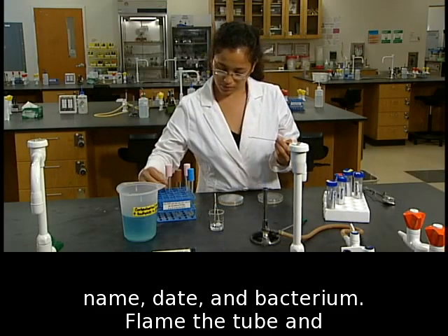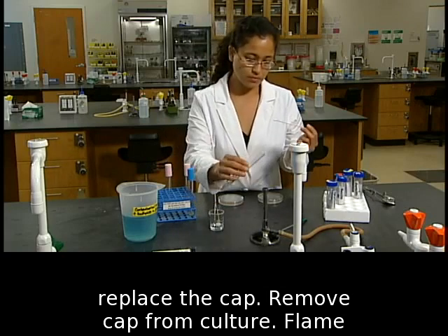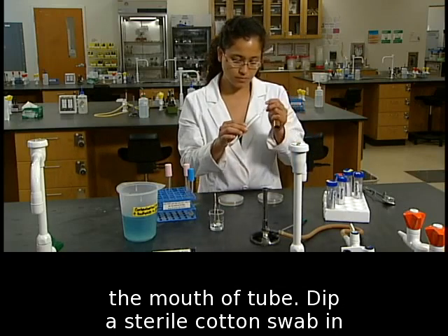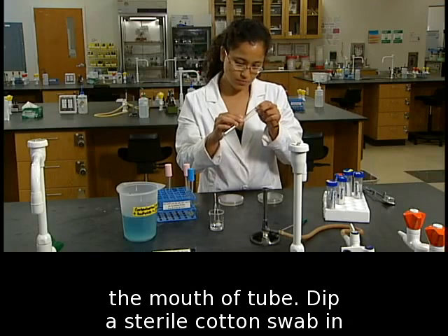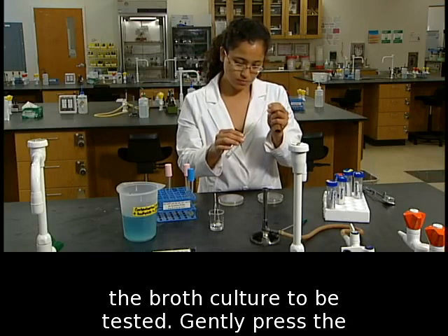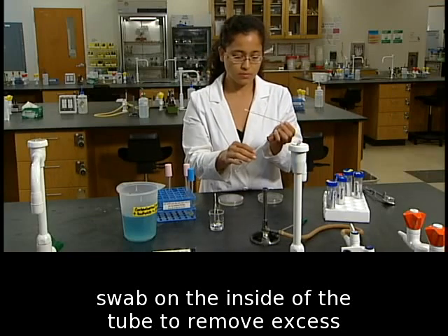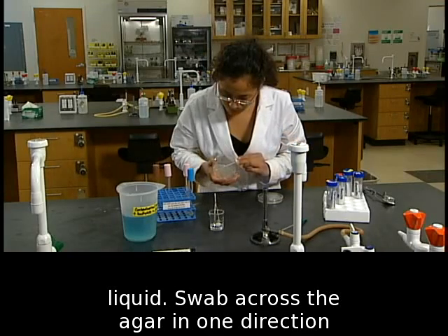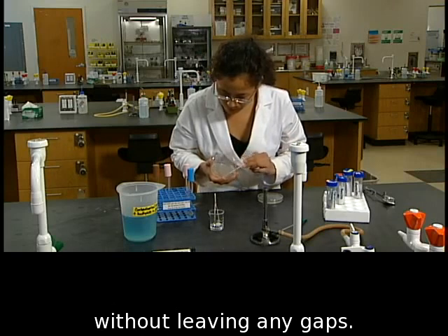Flame the tube and replace the cap. Remove the cap from the culture and flame the mouth of the tube. Dip a sterile cotton swab in the broth culture to be tested. Gently press the swab on the inside of the tube to remove excess liquid. Swab across the agar in one direction without leaving any gaps.